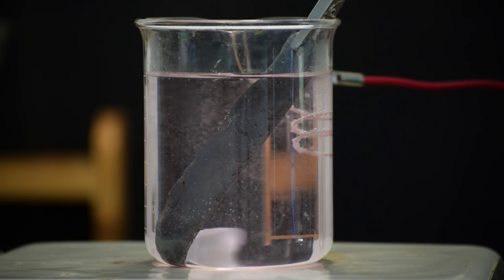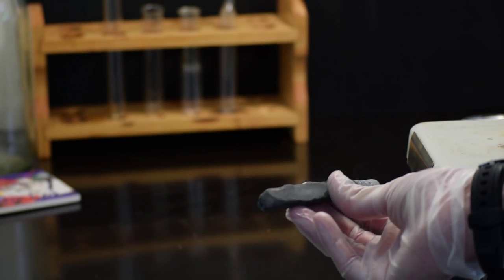Hello, this is Gopher King Science. Today I'm going to be showing you how to make lead dioxide electrodes, which have similar properties to platinum electrodes, but for much lower cost.